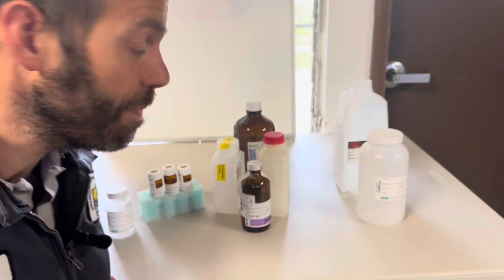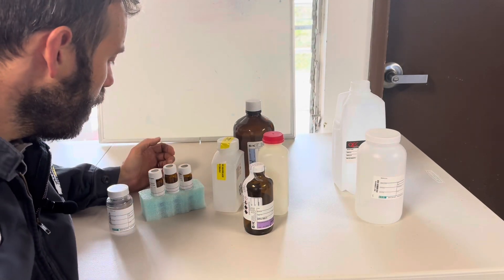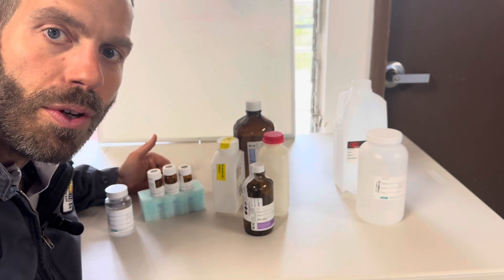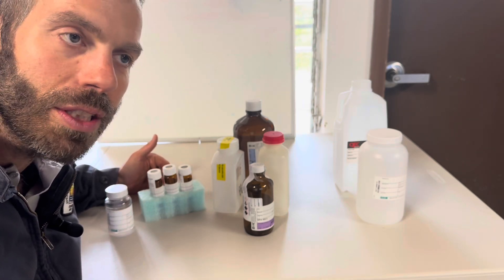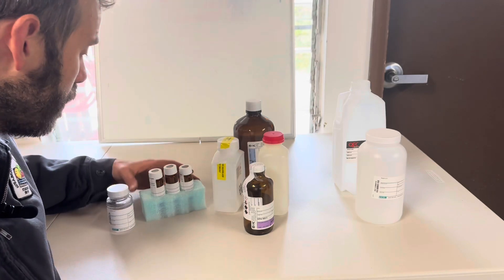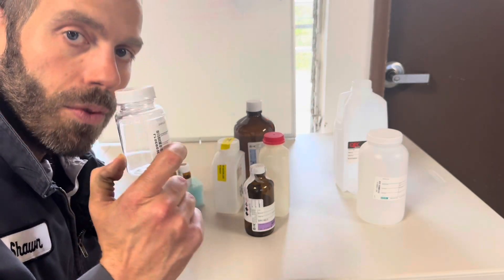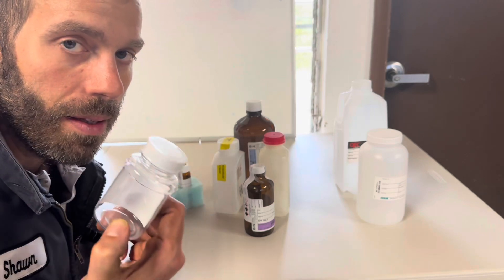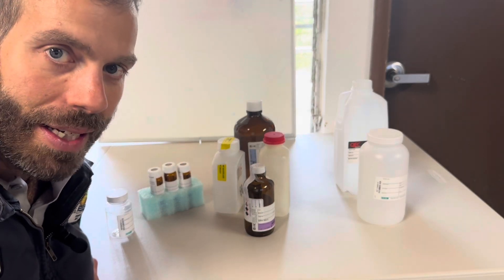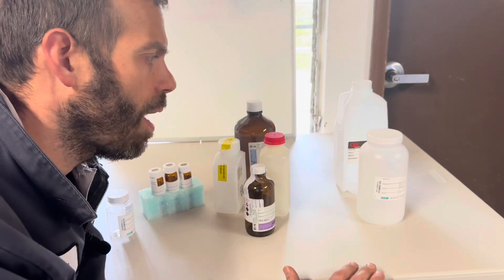If you have broken custody seals, you should not be using them — you may be asked about that. Here's an example of an intact custody seal. VOA vials are zero-headspace samples — no air in the sample at all. If the lab sees an air bubble they'll reject it. And here is a bact jar — what you should know is these are 100 milliliters minimum, because of how the MPN (Most Probable Number) of coliform colonies is expressed. I'll get into detail on that when we cover disinfection.